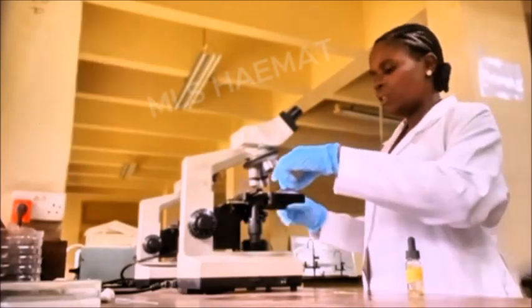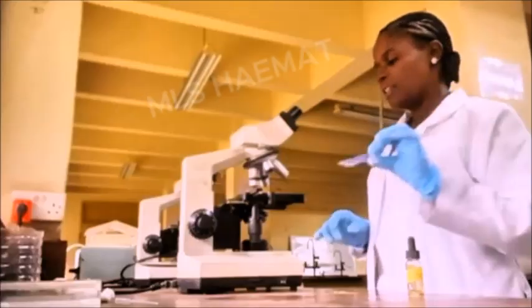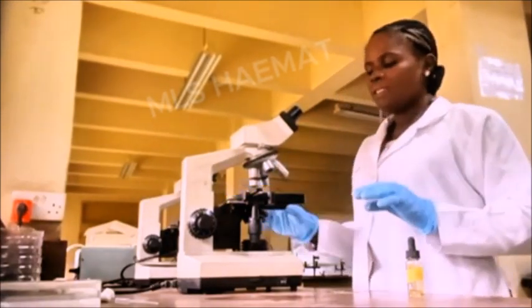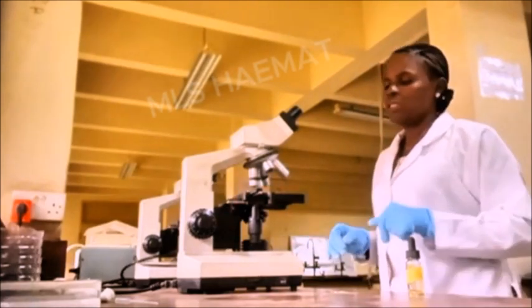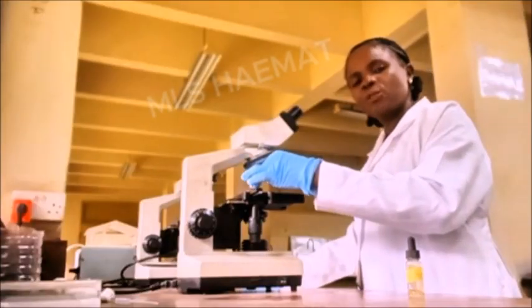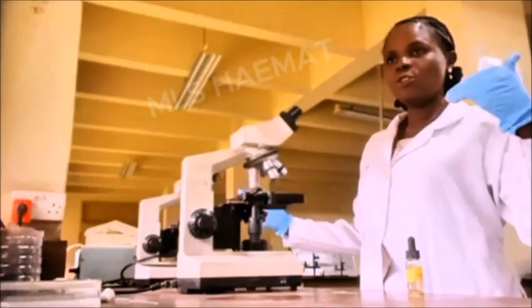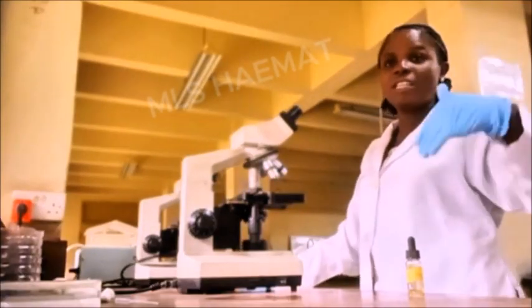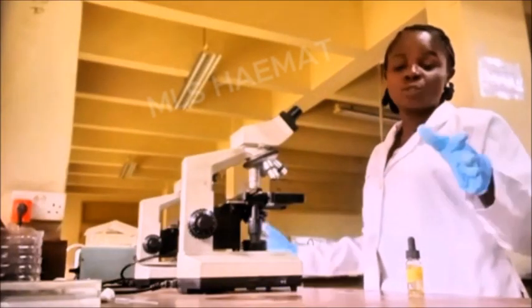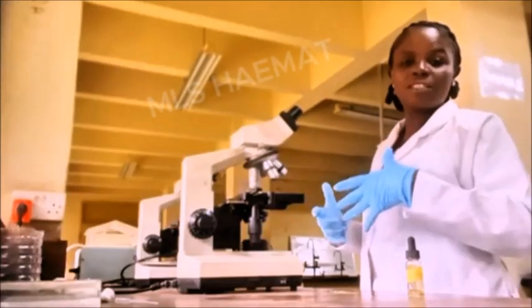So this afternoon, I have a gram stain slide that I want to focus under the microscope. As usual, I'll place the slide on the mechanical stage. Then I'm going to turn the objective lens to the oil immersion objective lens directly. In the last video I did for you, I told you that you can start with the scanning objective lens, move to the times 10, times 40 before the times 100 objective lens. But some of my students found it difficult to use that method, and that's why I discovered this new method, and I feel like it will be better for you compared to the other one.